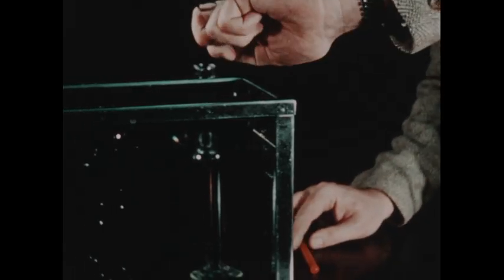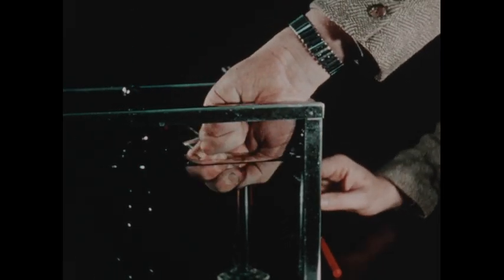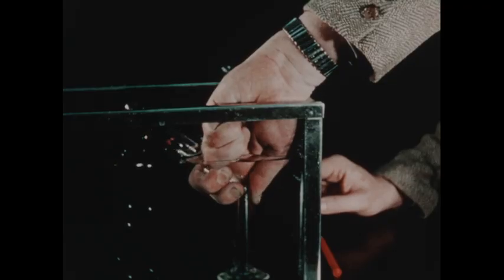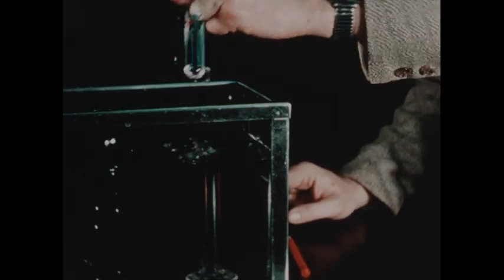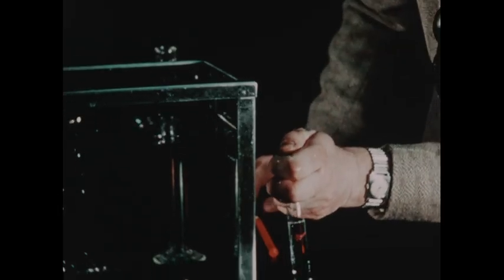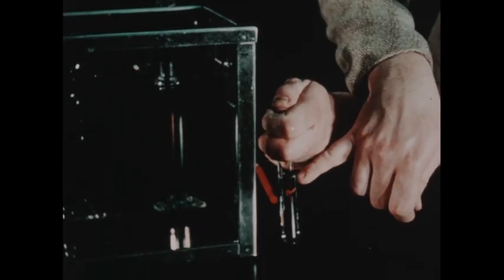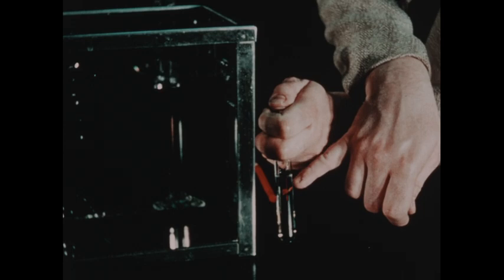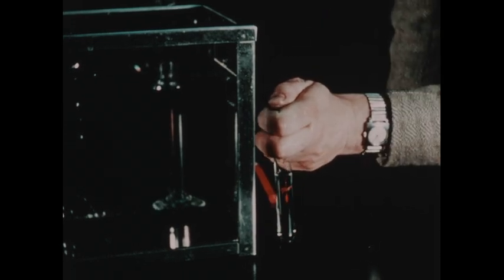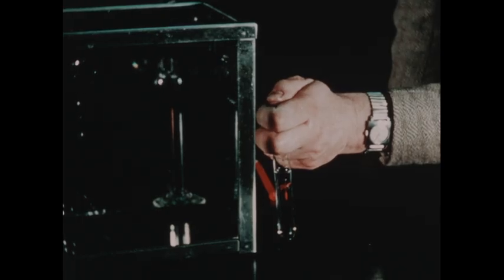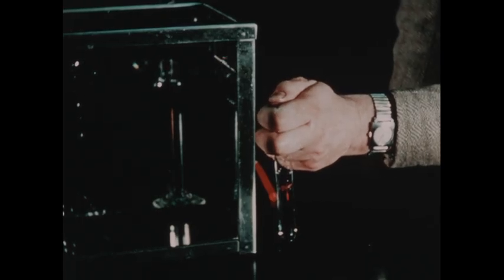Now, we'll transfer the tube to the trough, remove the thumb, replace the thumb, bring the tube back outside, and you can now see that the water stands at a substantially higher level in the tube than it did before. The extra water has replaced the nitrous oxide, which dissolves in the cold water.